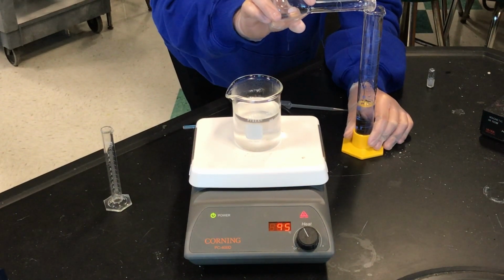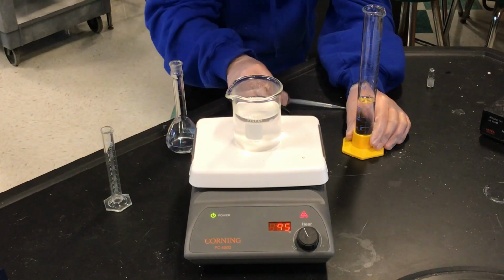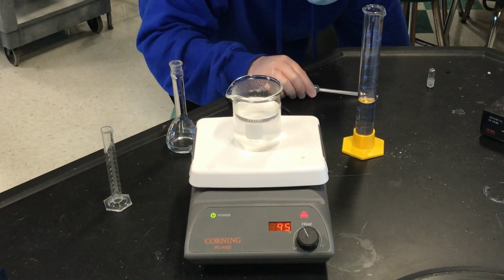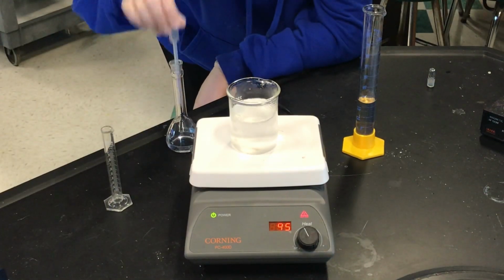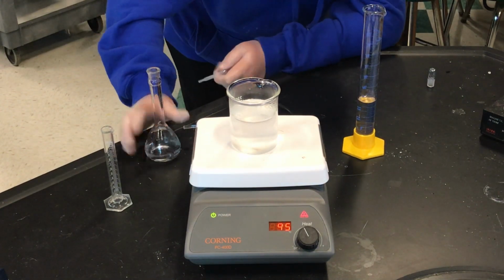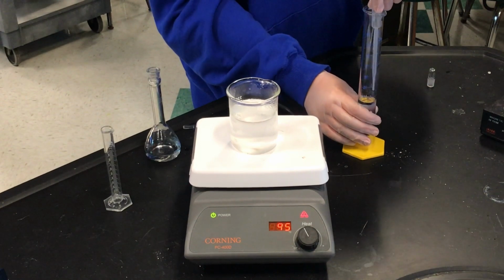All right. Now, once Evan measures that exact amount and makes sure he pipettes that, he's going to pour all of that into that beaker that has the heated aspirin. Well, he could be Evan because he's student E. Gotta turn that, and we're almost done. So you can see the preparation is intense in terms of all your decisions, and how they change when you standardize. But we're almost there, okay?